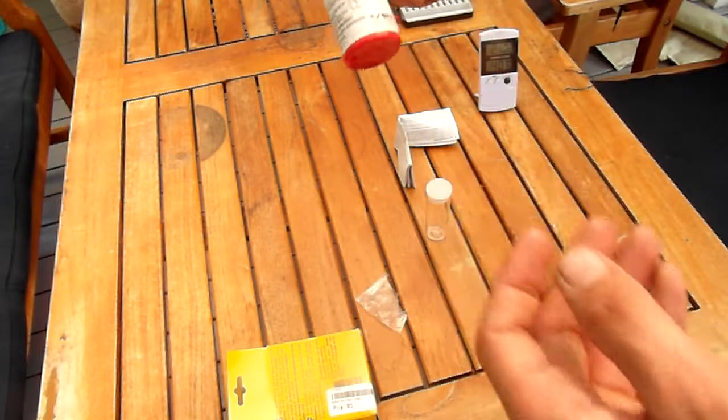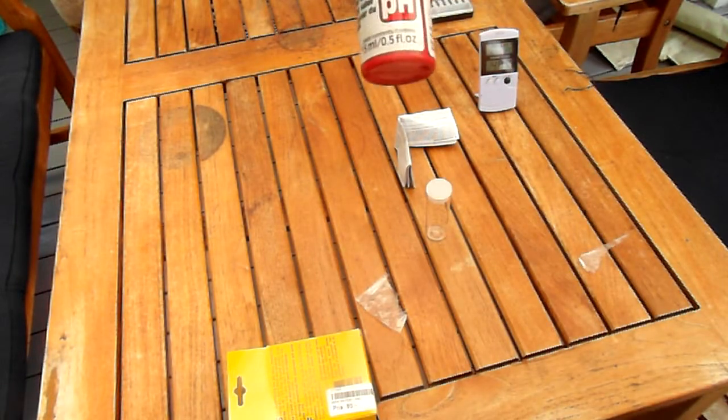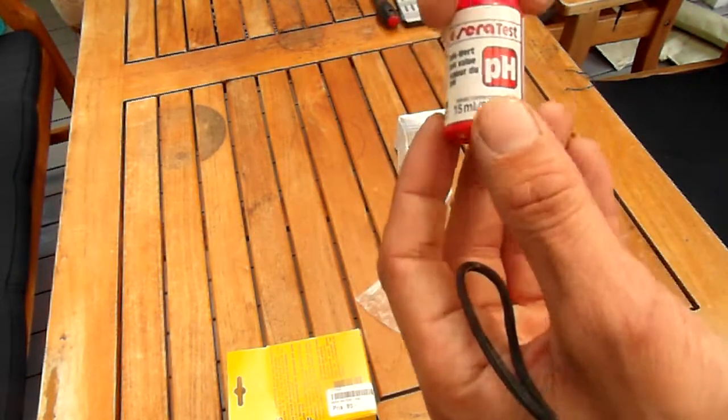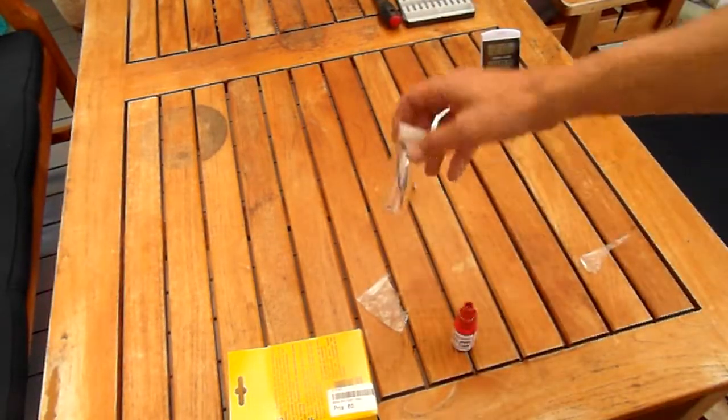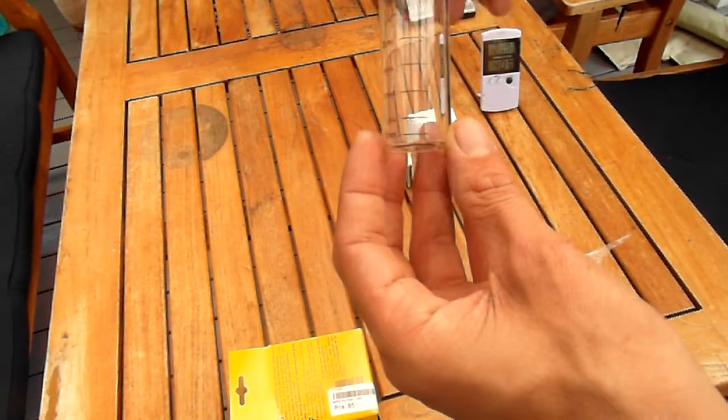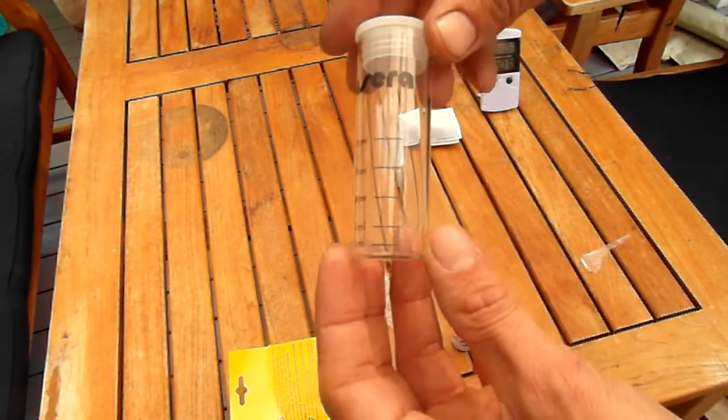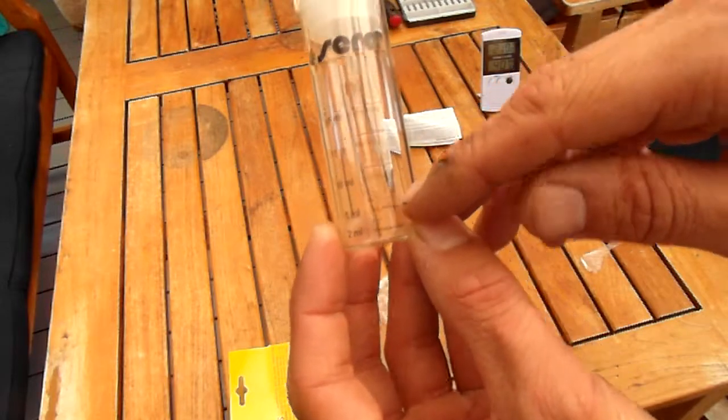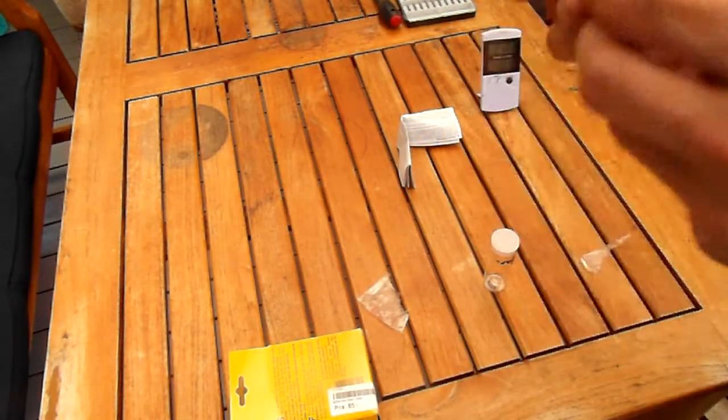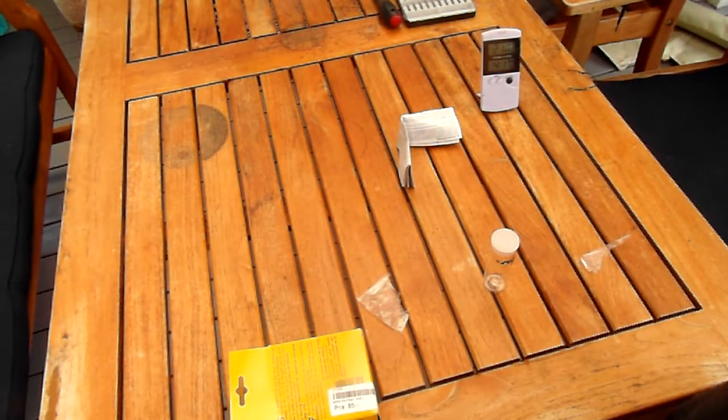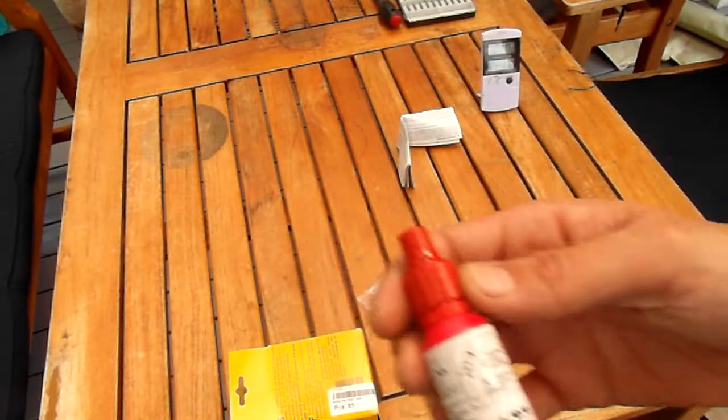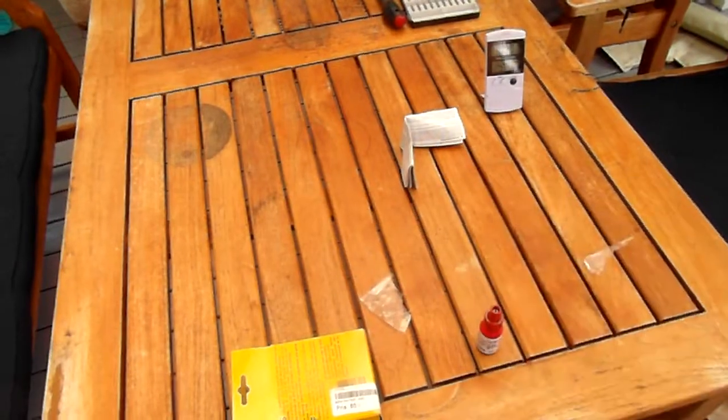This is some kind of reactant I hadn't looked it up yet. You're supposed to rinse this bottle with water, fill up to the five milliliter mark, and then add four drops. So let's do that right now.